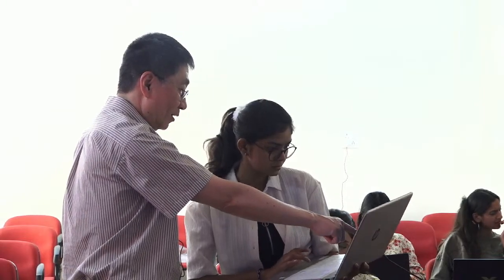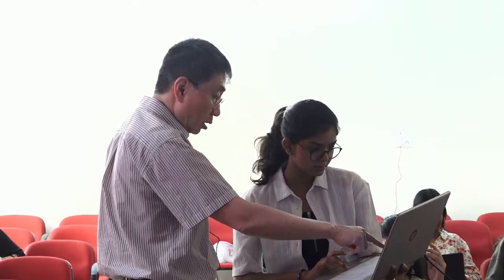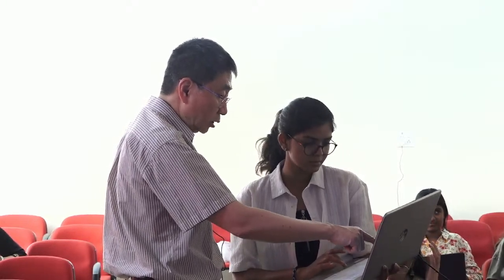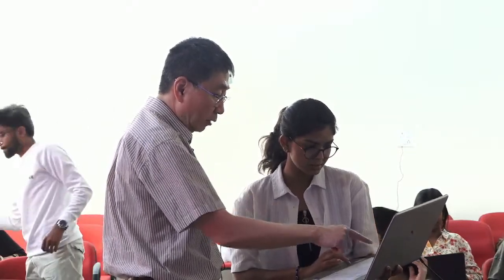Okay, I don't know what's going to happen now. Let's see. Click on the alanine. No, that's valine. Click on here. Okay, there you go. Select lysine. There you go, so then you should have it. What has just happened here? Let me see. Oh, it built another residue for you. So you can delete this residue, I guess. Yeah, you can delete that one. So delete.